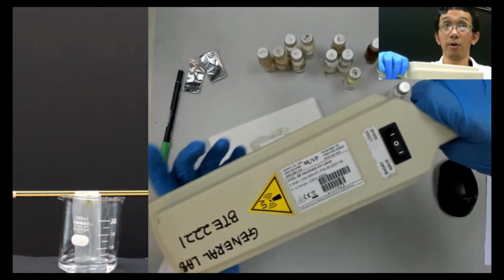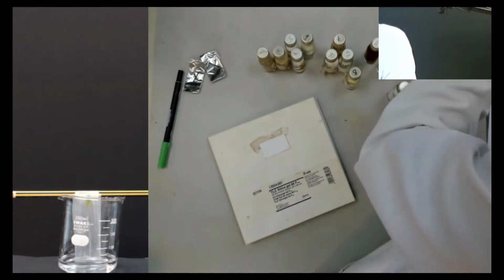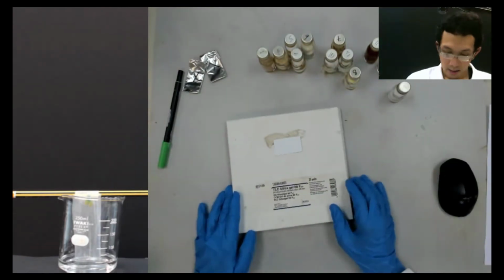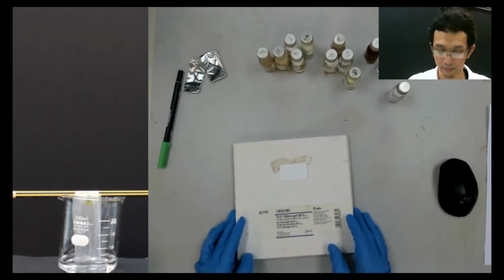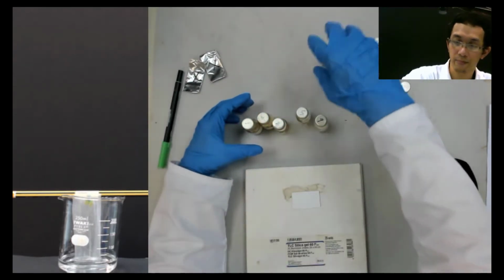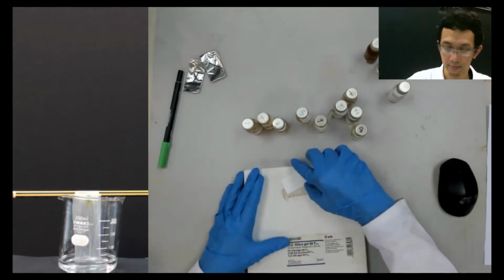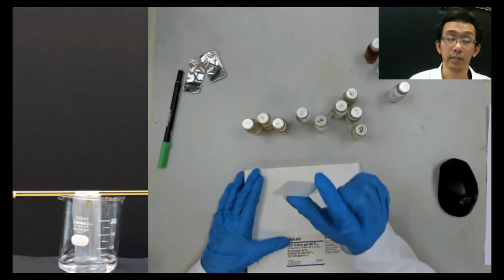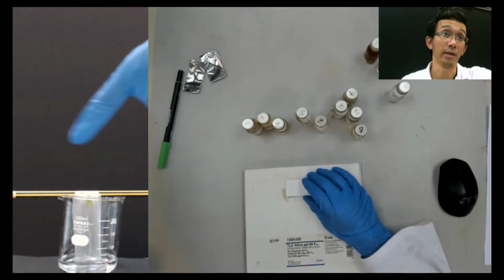So that's basically about the UV light. Later on we will see that again. Now what's next is, let's put it away and see this first. That's the idea of TLC, thin layer chromatography. It's thin, you see, it's thin. And chromatography is the one that we want to do like this.